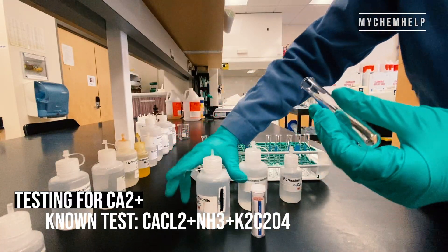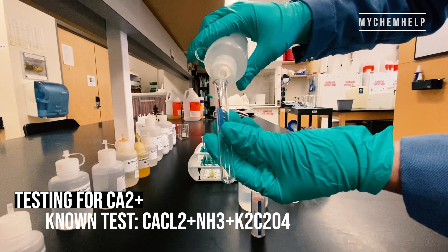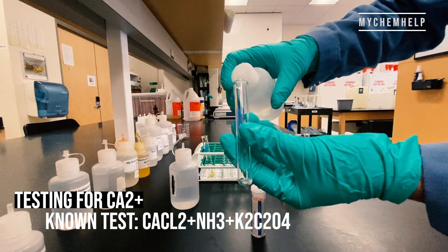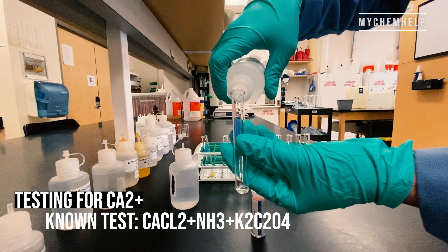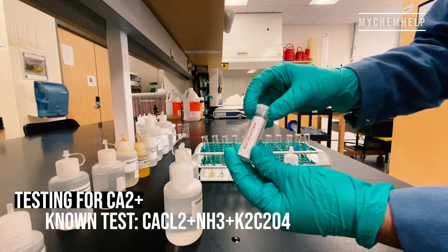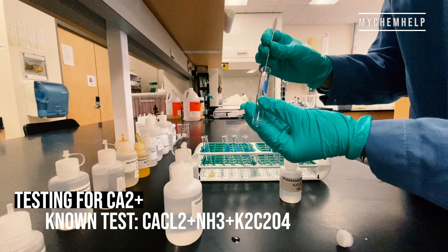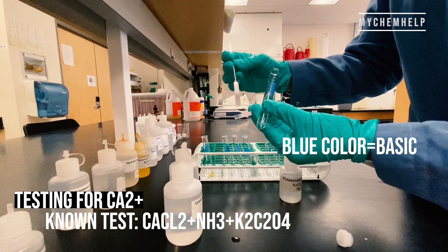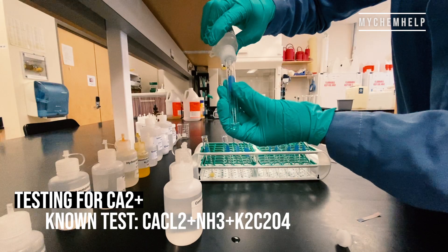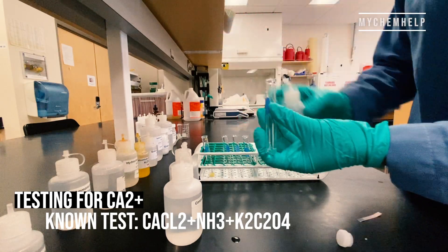Next we will be testing for calcium 2+ ions. This is our known test with calcium chloride, a bit of ammonia. We're going to test to make sure that this solution has been made basic by the ammonia. I've got a red litmus paper and I'm putting a dab of that solution onto the paper — it's blue, so it indicates that it is basic. And lastly I'm going to add some potassium oxalate to the solution.